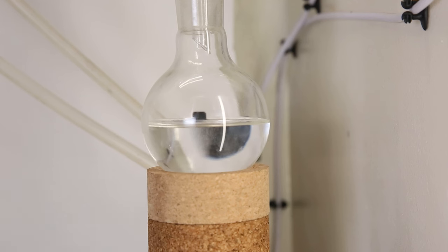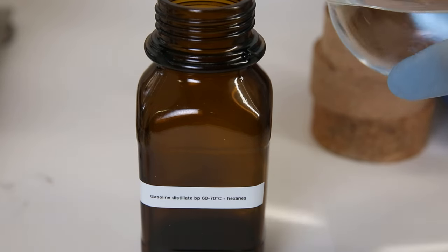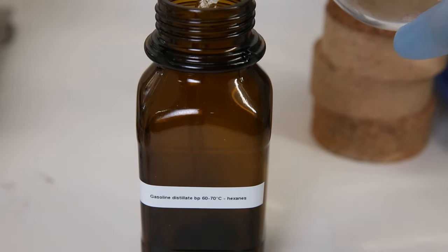A lot of liquid came over at this temperature, and after it seemed finished, I took off the receiving flask, and poured the second fraction into a new bottle.